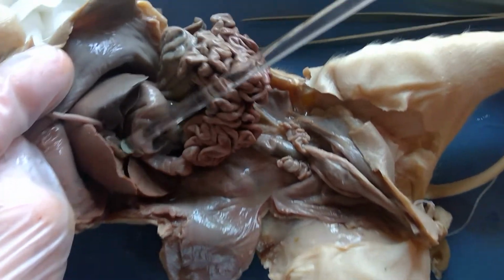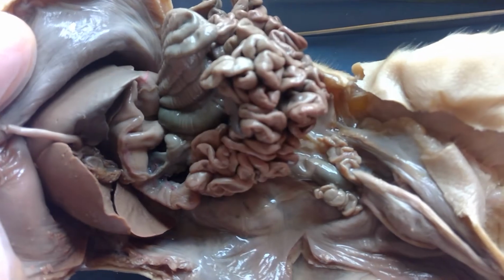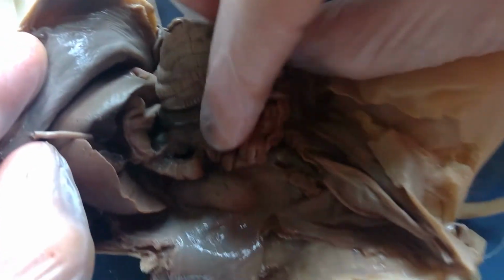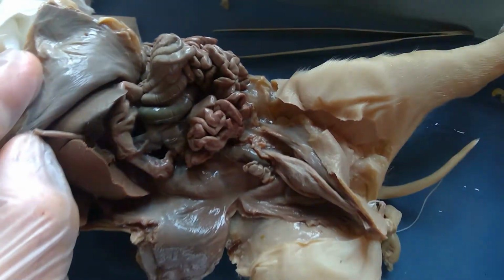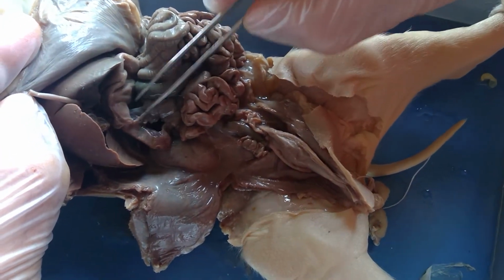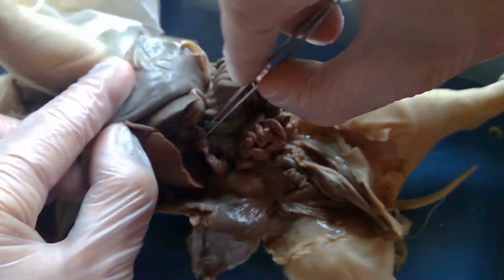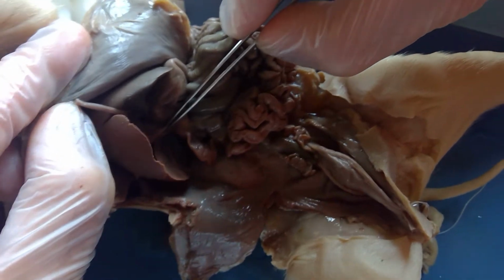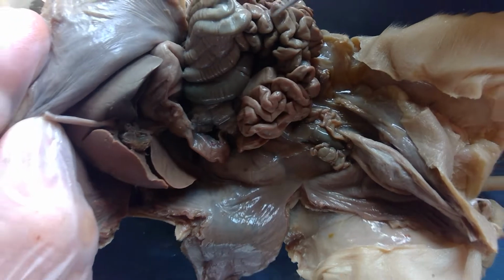So then again, that right there is the gallbladder. This is the stomach. You have the small intestine, the large intestine. You have the pancreas, and then you have this common duct right here that is going to put pancreatic juice, and then on this side, the other branch of it is here, and that's going to put the bile into the small intestine.